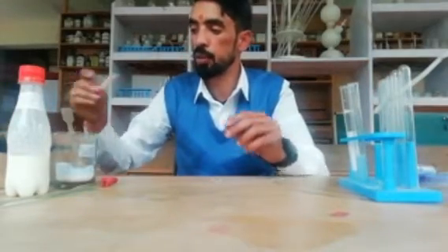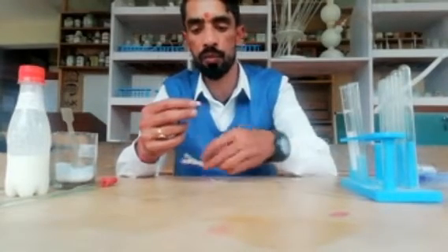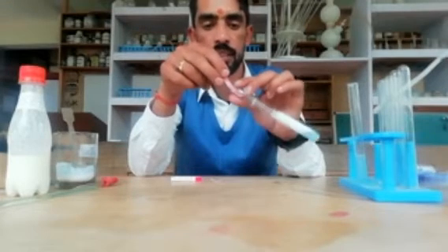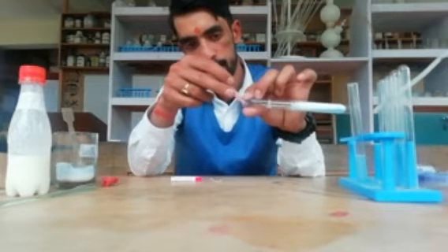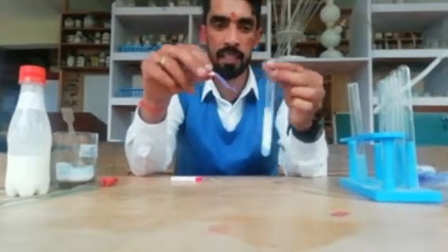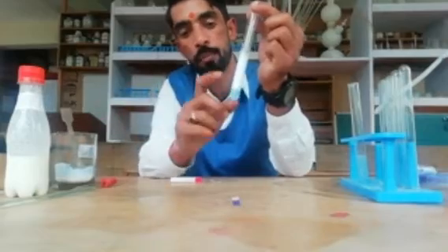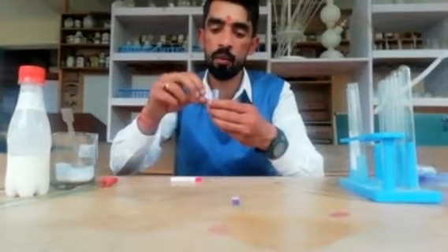First, we are going to check with red litmus. We have two types of indicators: one is litmus and second is pH. To check whether the solution is acid or base using red litmus, we need to see if the color changes to blue. You can see — the moment this litmus comes in contact with the base, it becomes blue. This shows that the washing soda solution is a base.